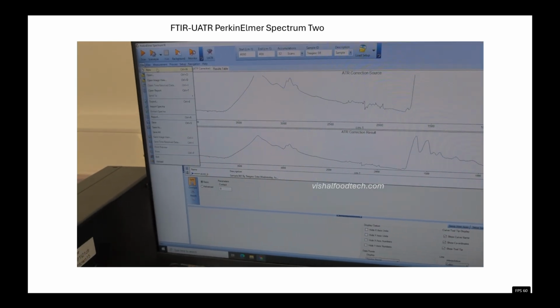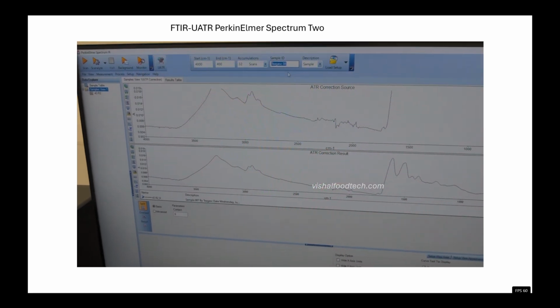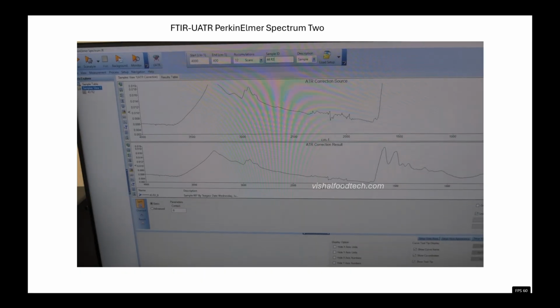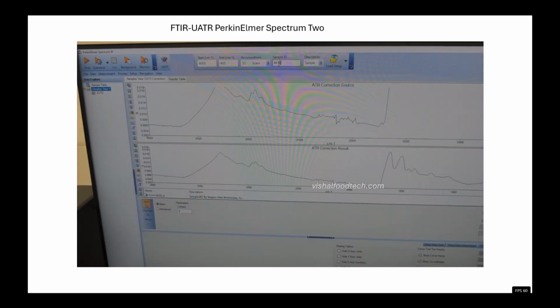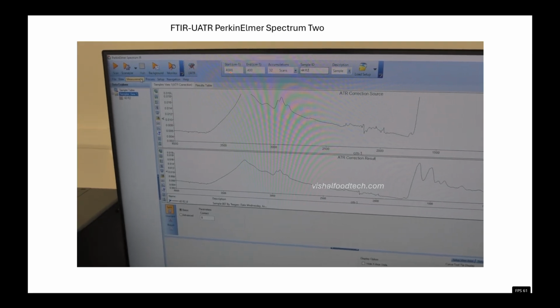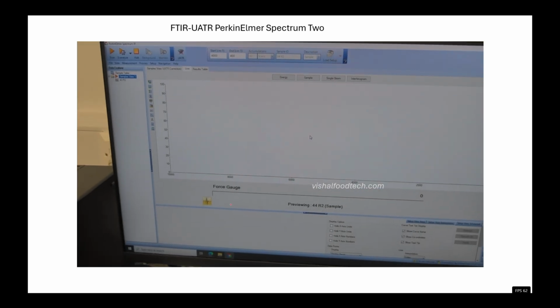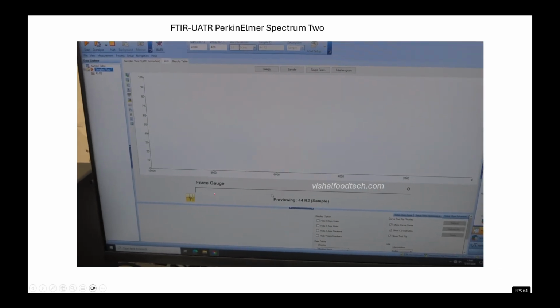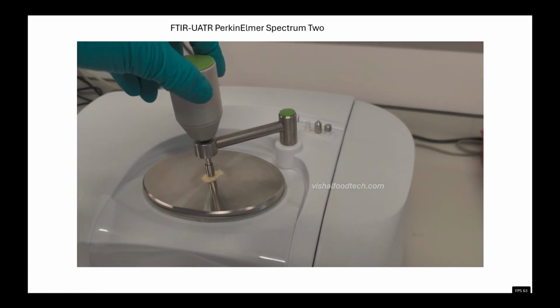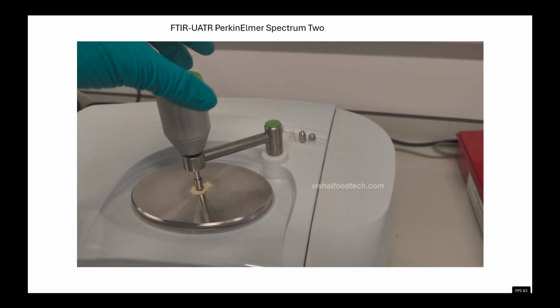And now here we will open file, and then we'll go to new sample, and we will change the sample name in the sample ID. For example, we change the name to 44 R2, and then we are setting 32 scans in the accumulation, and the wave number we are selecting 4000 to 400. Now we will go to measurement and scan. So here we are seeing the force gauge. First we will rotate a little bit clockwise, and then the force gauge percentage will increase.